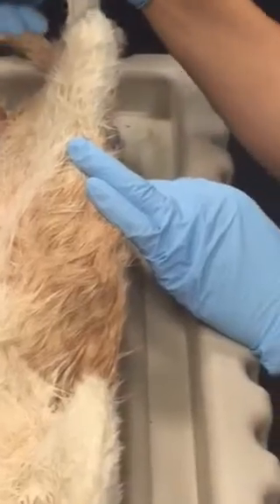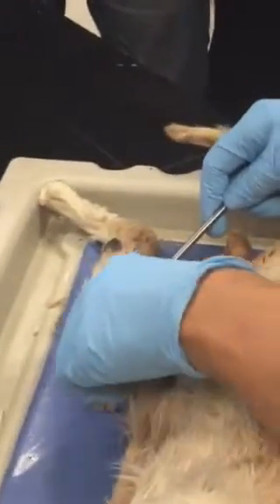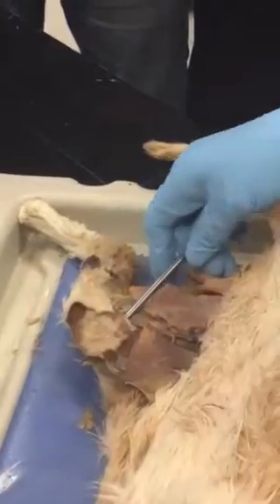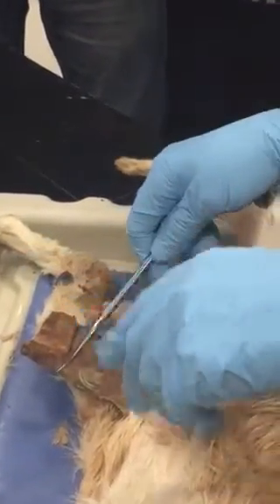This, gracilis. If I test you on the superficial one, I wouldn't just pierce it like this. I would probably leave it here and then pierce it, so that you know it's a superficial muscle like this. That makes sense.